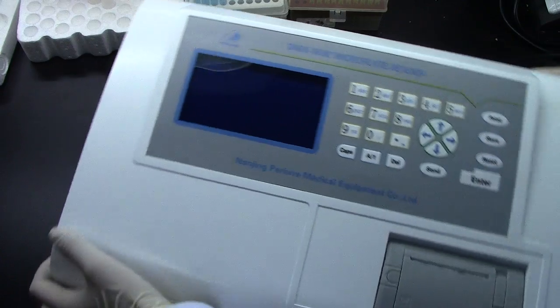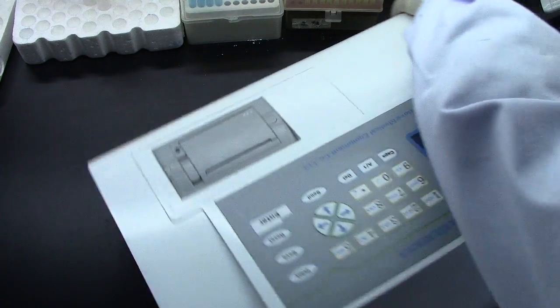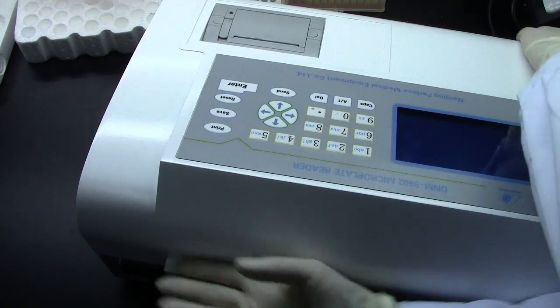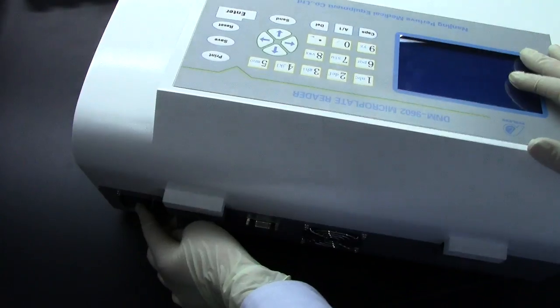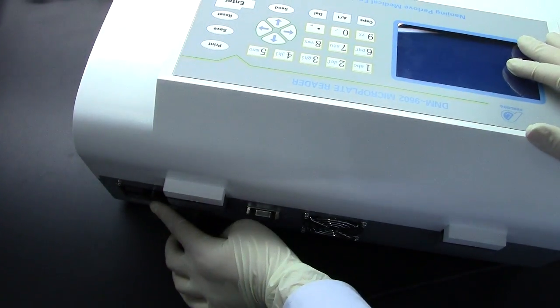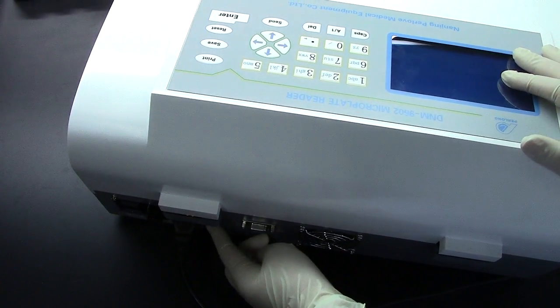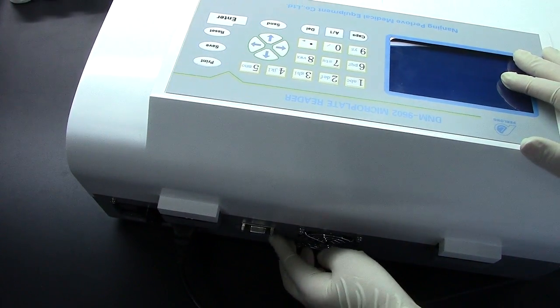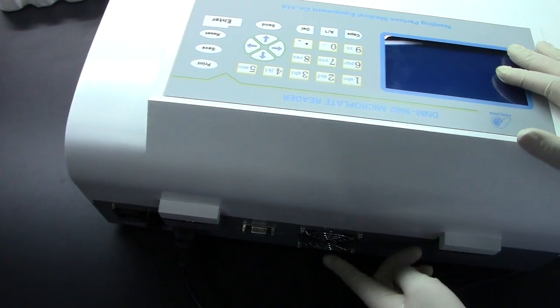On the back side of this machine, it has the power, the fuse, the socket, RS232 interface, and fans.